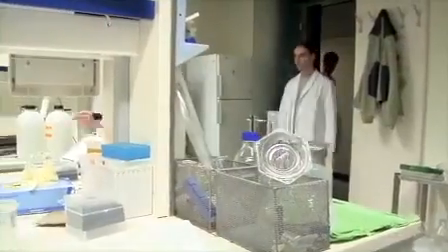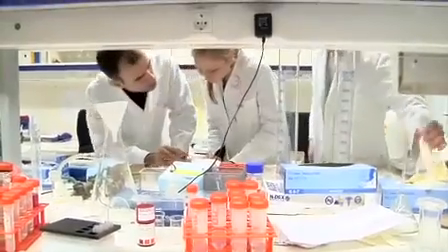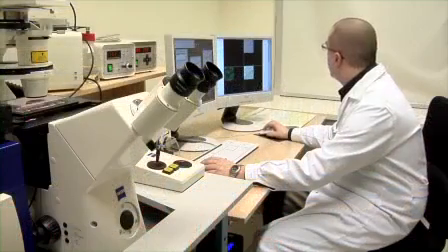in the treatment process. We designed an experimental protocol in order to allow the observation of cellular connections and even subcellular mechanisms during ischemia reperfusion injury and after stem cell transplantation. Our design criteria were a fully in vitro system where only the host and the donor cells are present, so it is isolated from the surrounding tissue.